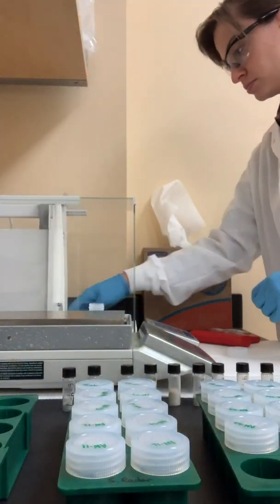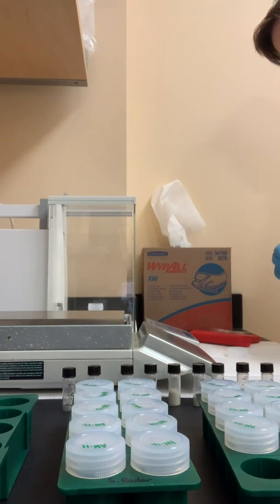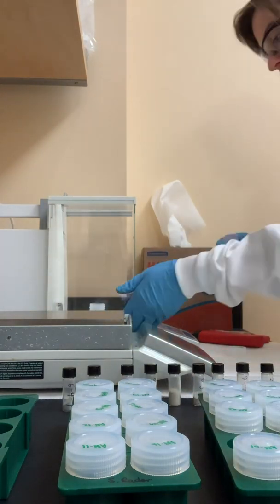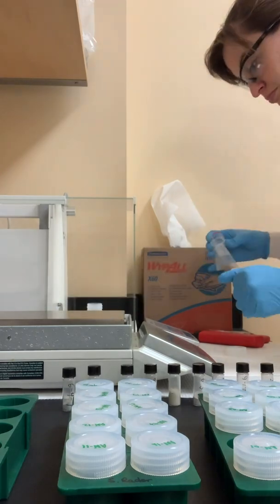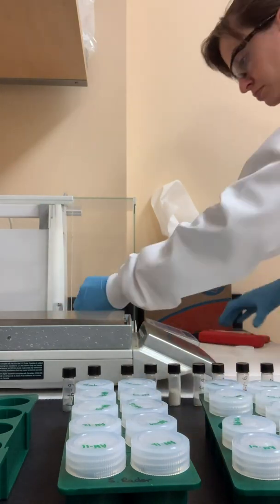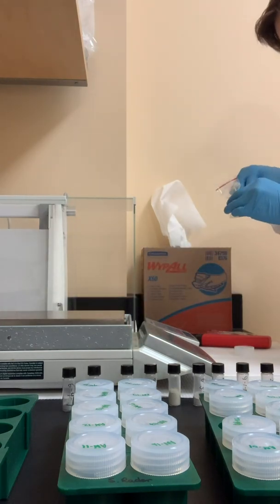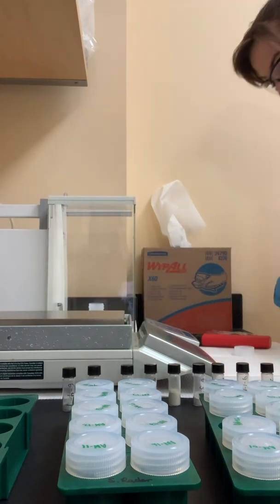Once we have our sample crushed, then it's time to weigh it out. Here we have to be really precise and really careful because this is how we ultimately determine what the concentrations in our metals are. It all depends on how much we weigh out. So this is kind of a labor intensive process, and you have to be fairly careful and avoid contamination.